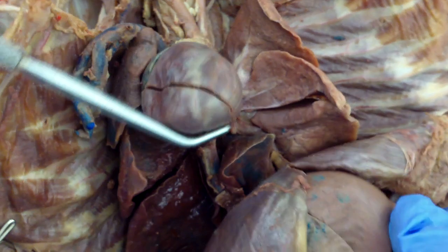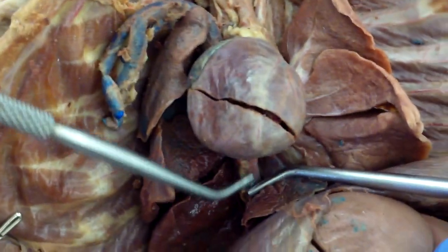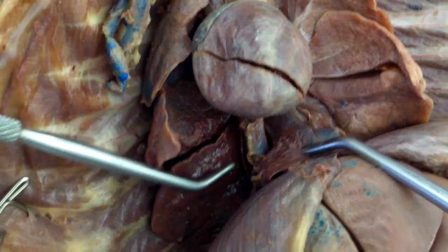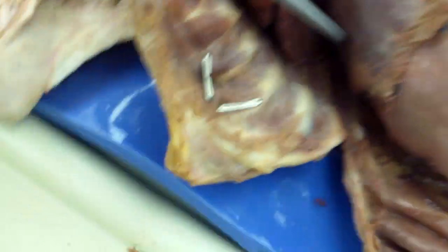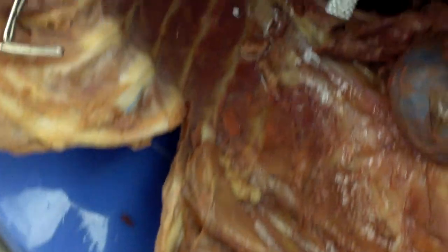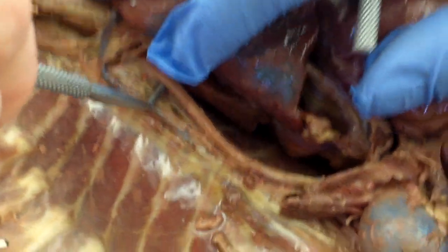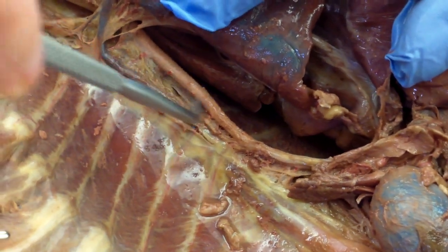Going below the heart. You can kind of dig in there and see the descending aorta right here, underneath here. There we go — here is a continuation of the descending aorta.